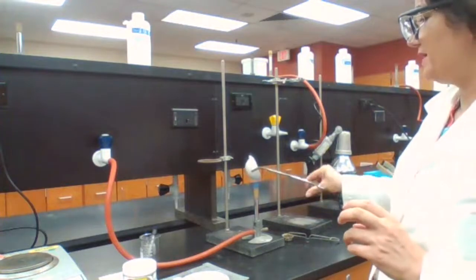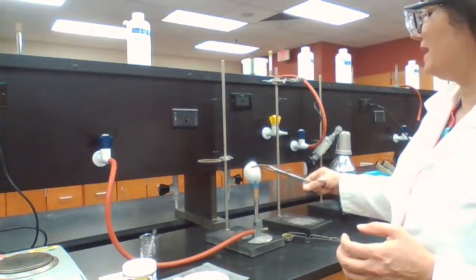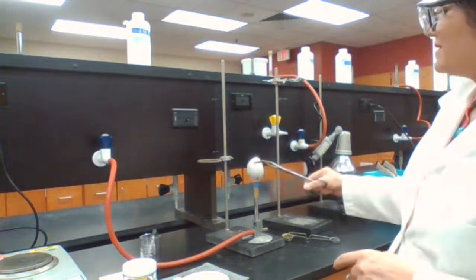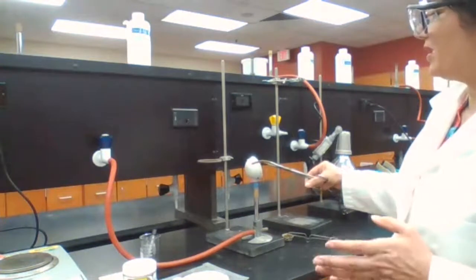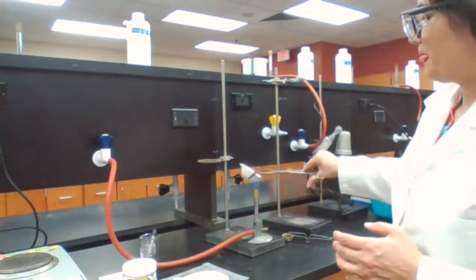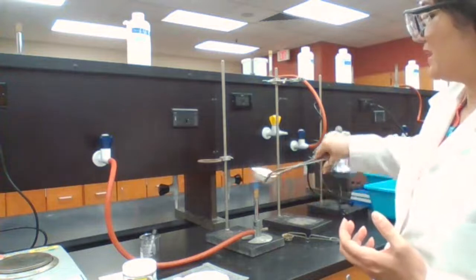I hope you understand the firing part, the firing of the evaporating dish, just to remove anything that is volatile, anything that is going to affect the mass later. If we don't do that, and you see these brown spots here, the mass is not stable. If, let's say, you have a paper there and you measure the mass after you heat this for a long time, it's going to burn the paper, and the mass gets lower, and it's going to cause experimental error.